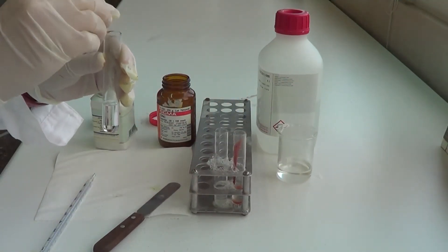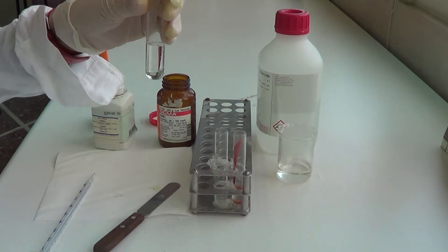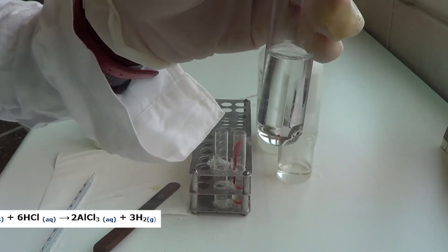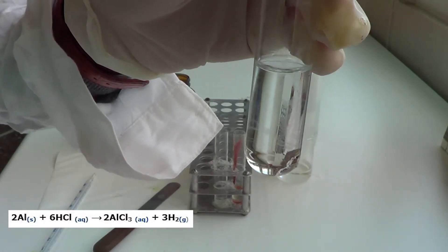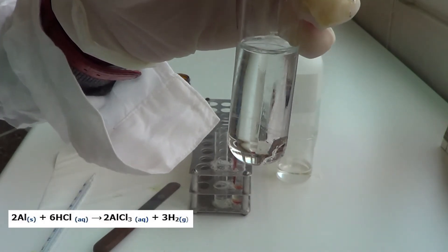We add aluminum powder to the last tube. The reaction is very intense because aluminum is more reactive than both hydrogen and zinc.